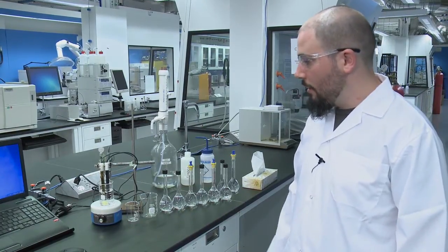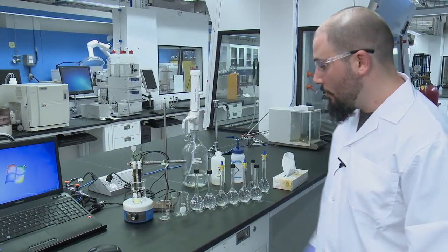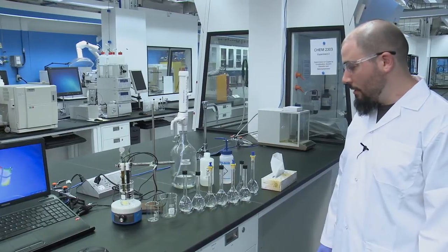In this experiment, you're using a reference electrode and fluoride-specific electrode to determine the concentration of fluoride in an unknown water sample.